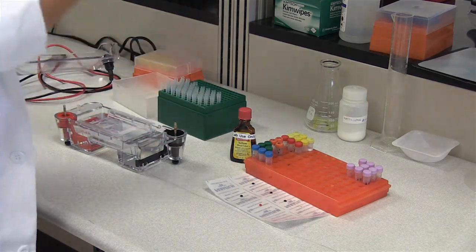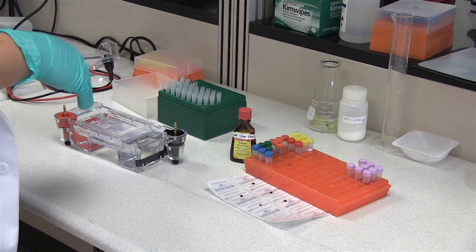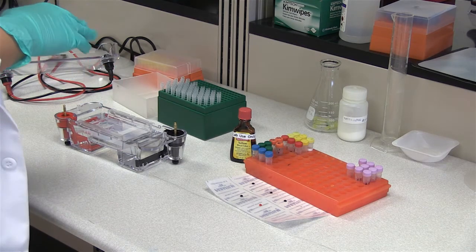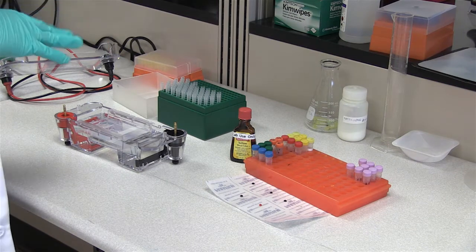You want to make sure sample one goes in well number one, sample two goes in well number two, and so on and so forth. And that way you're not later questioning how that happened. I would suggest while this is running to take time to draw a map of your gel.